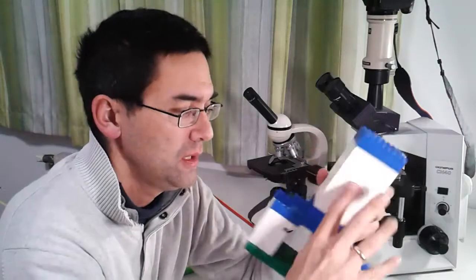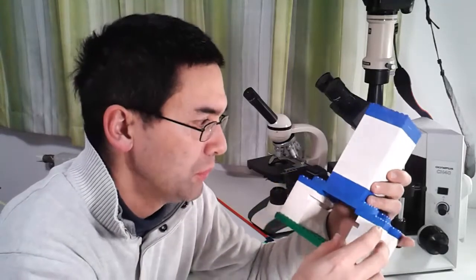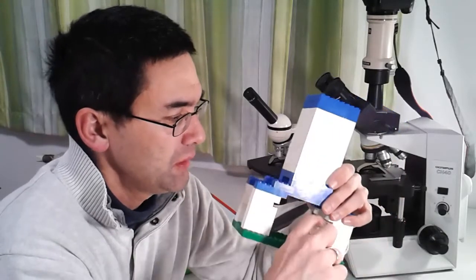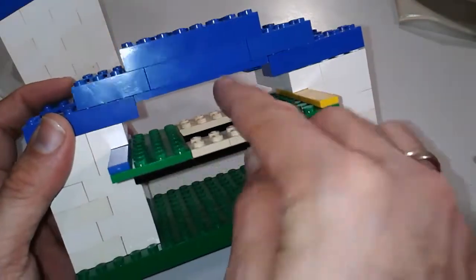What I've done is use those four-by-two bricks, and I put them together in such a way that I have a very nice little square in here. This is just enough to accept the film canister — you have to squeeze the film canister together a little bit, but that's okay. The bottom part design is really up to your own creativity. I simply constructed it like this and I put a little guide in here so that the stage can slide in and out.